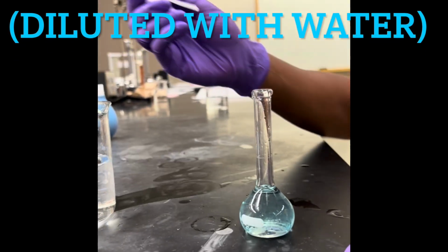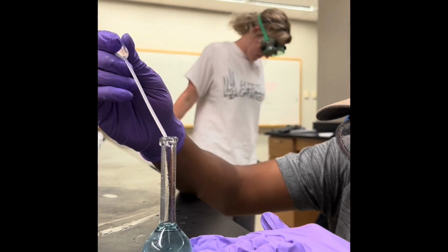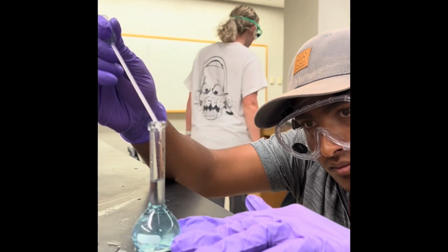The solution is then diluted in the volumetric flask using the transfer pipette. The meniscus of the volumetric flask can be seen sitting directly on the mark.